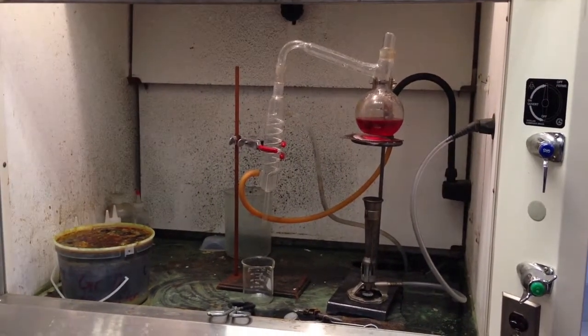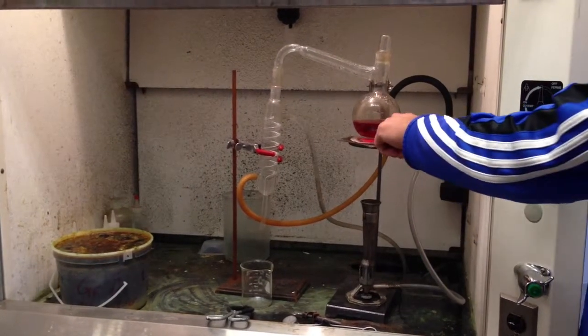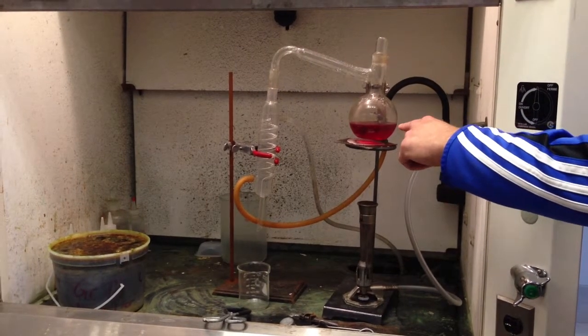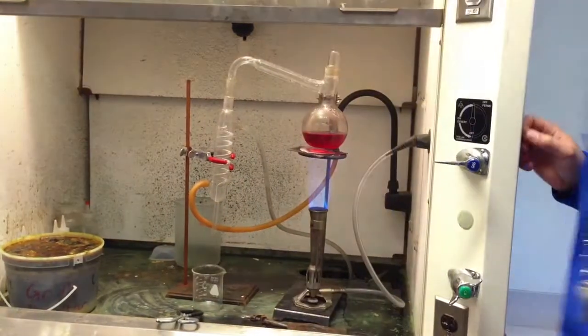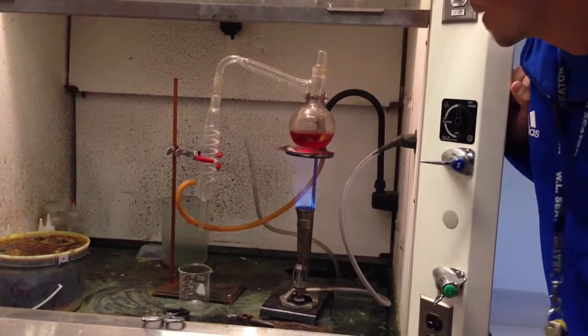Even when you're below the boiling point, are the liquids stuck here? No, there's still always going to be at least a little bit of evaporation. Okay? So it's not going to be 100% pure, but it's going to be much purer than it was. And this is going to take about a minute. We'll do that fast forward, so just keep watching.